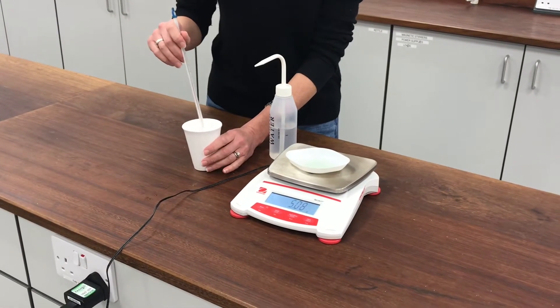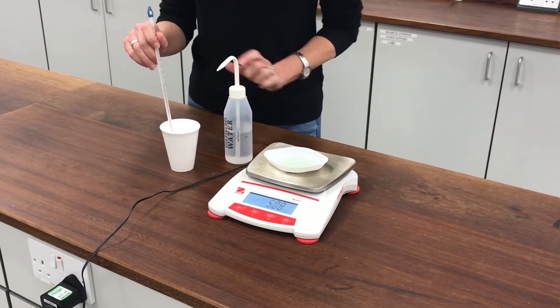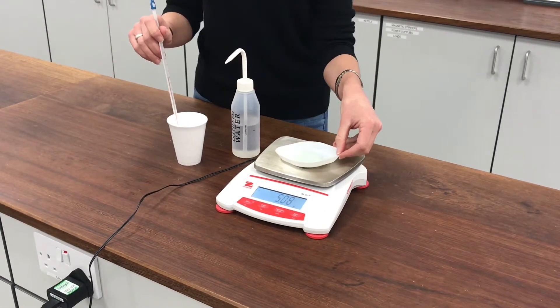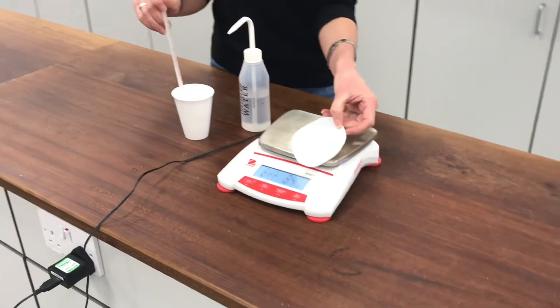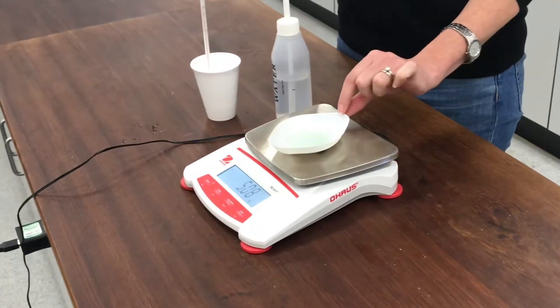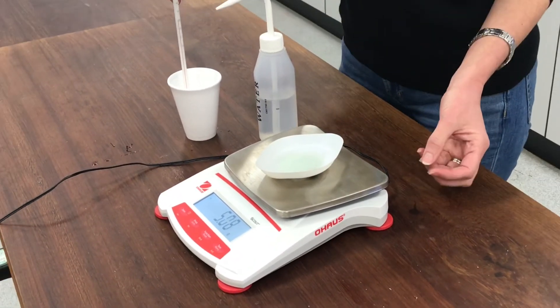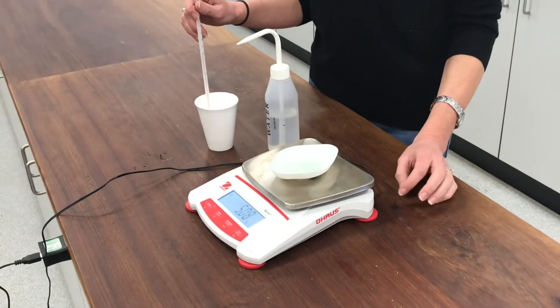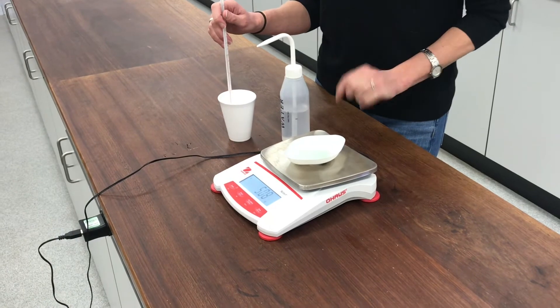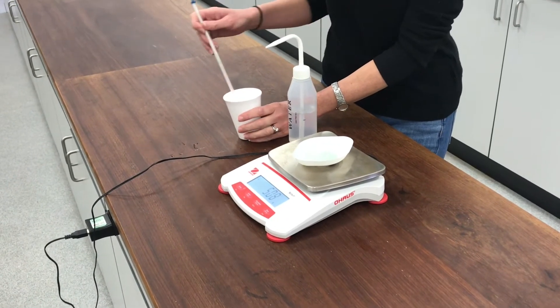This experiment is called Feeling Blue. In this experiment, I'm mixing some distilled water, which I've got in this polystyrene cup already, with some anhydrous copper sulphate. Copper sulphate is usually a really strong, deep blue colour, but this is much paler — almost white — because it's been heated and all the water of crystallisation that normally gives it that blue colour has been driven off. In a moment, I'm going to add this anhydrous copper sulphate to my water and we'll see what happens to the temperature.